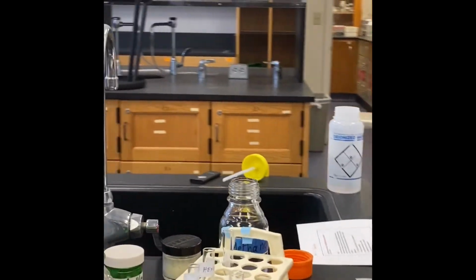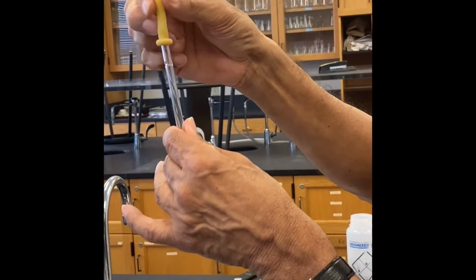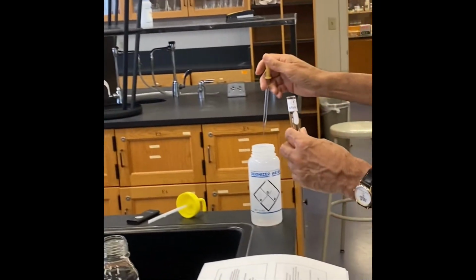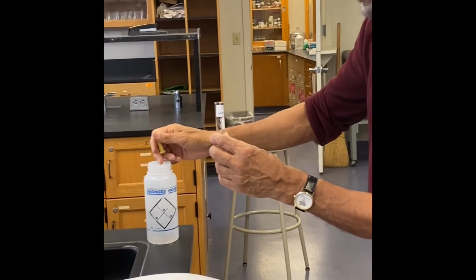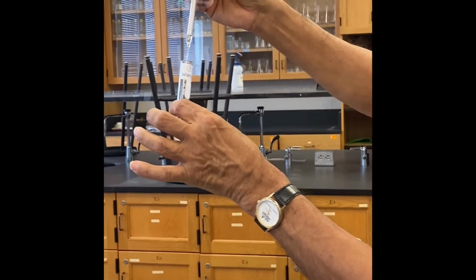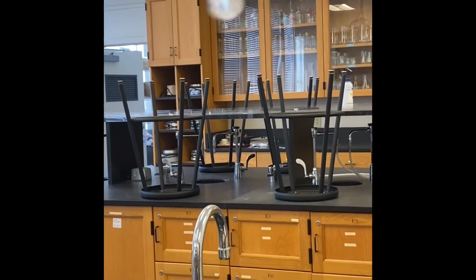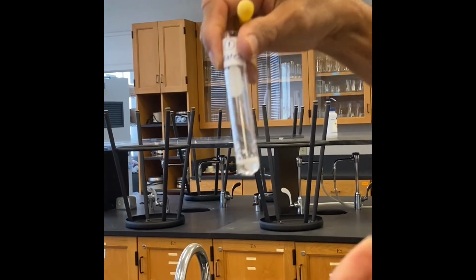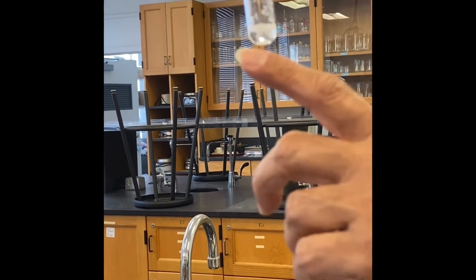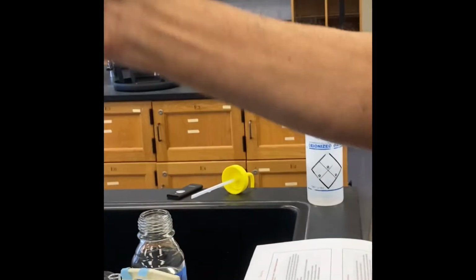Now I'm going to add solvent. These are called Pasteur pipettes, and this is the bulb for 1 ml. I will take the water one and add water. So this is water, right? Let me add 1 ml. See this 1 ml here, and add 1 ml. And then I'm going to shake this. You can see it doesn't dissolve. We'll come back and see again after 1 minute. But right now, adding water doesn't dissolve it, it just suspends. Now, I can't use the same pipette, so I'll keep it here.